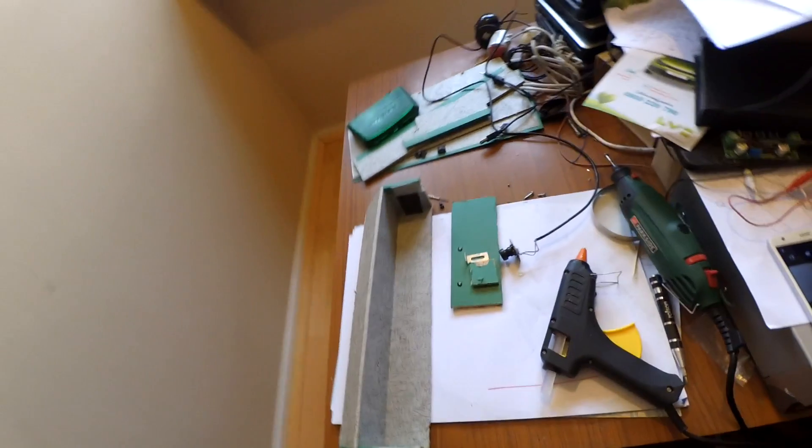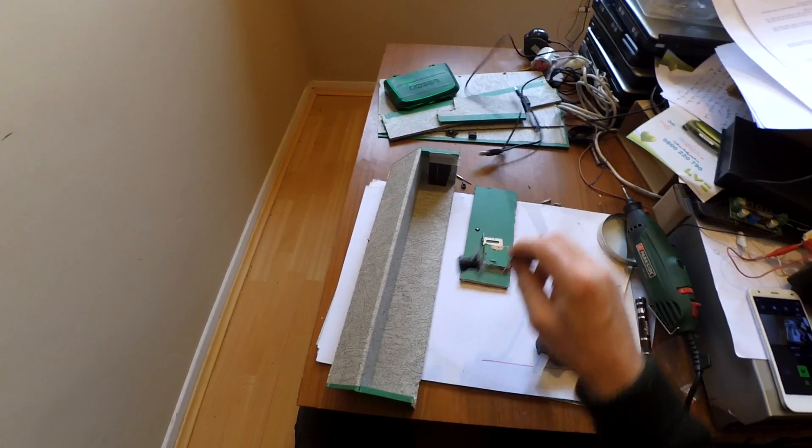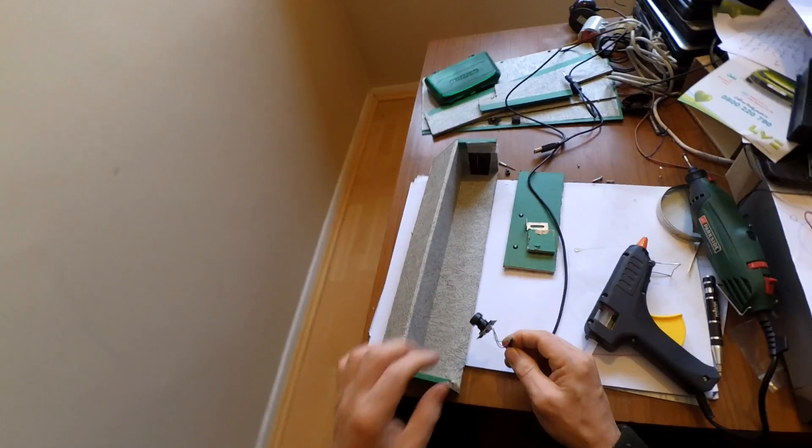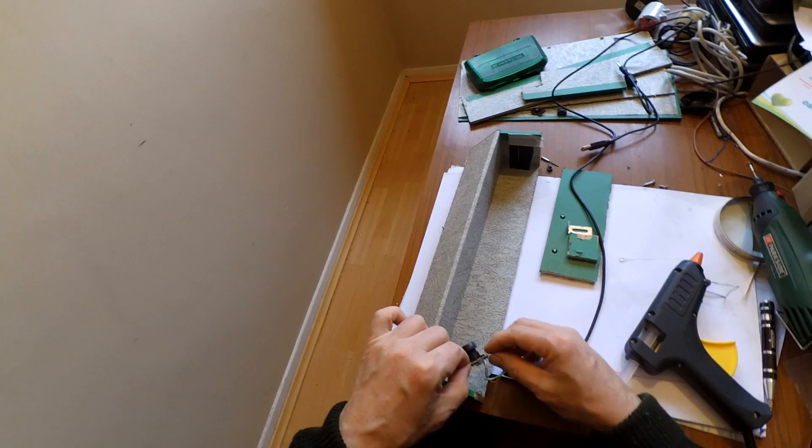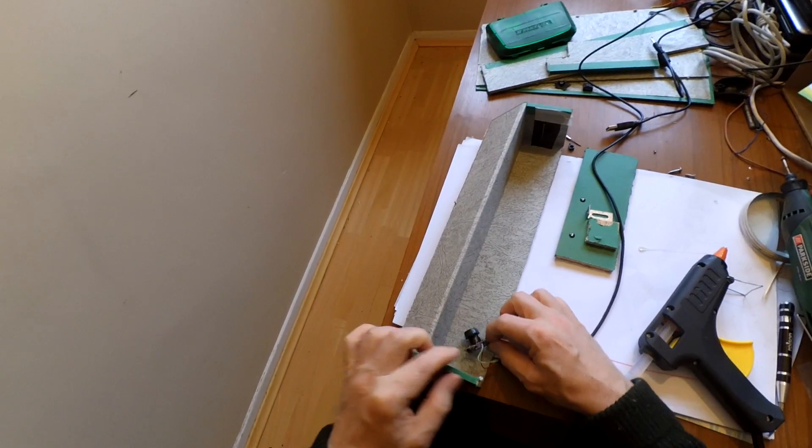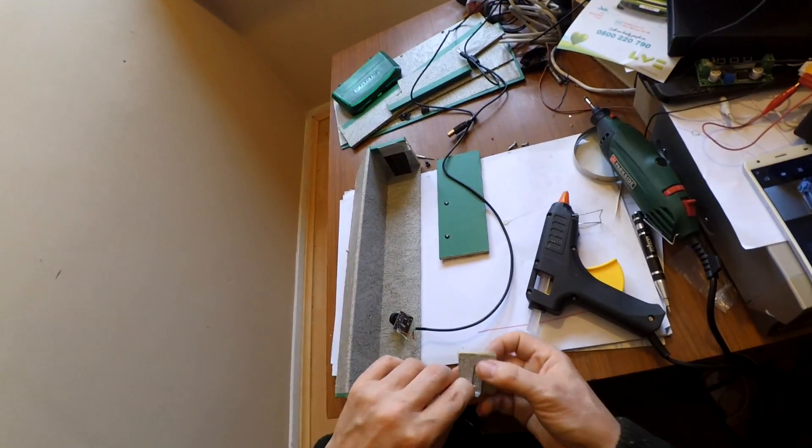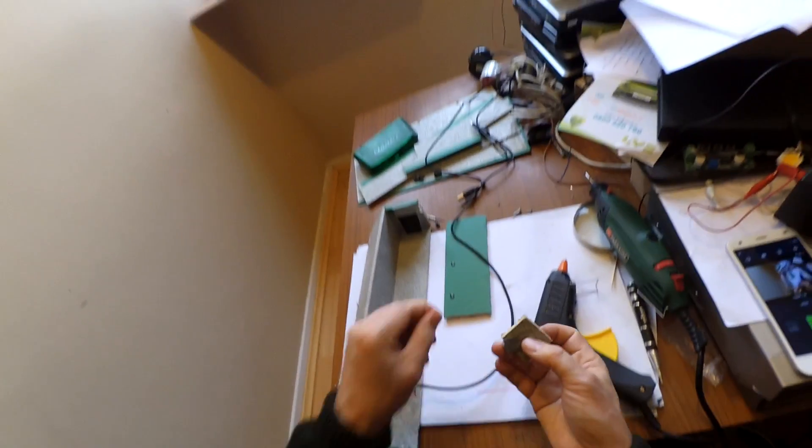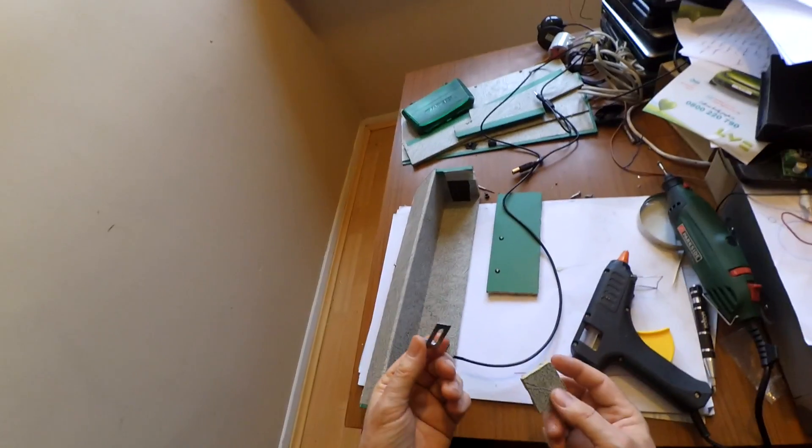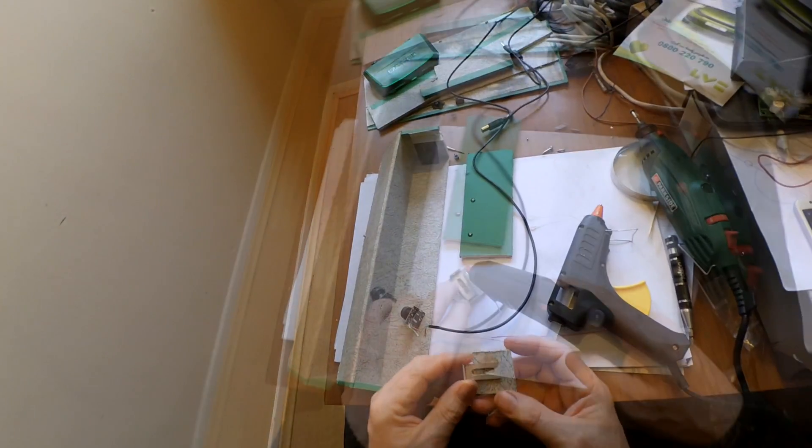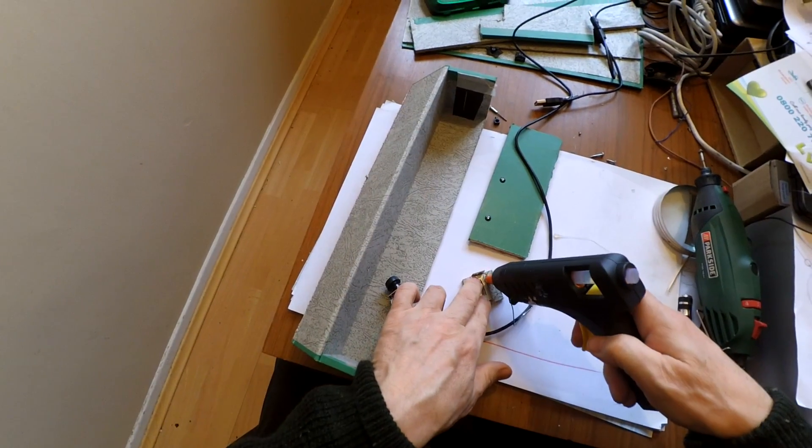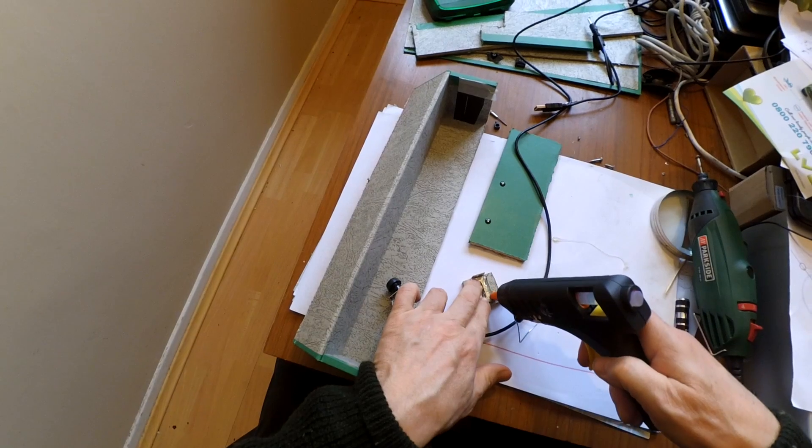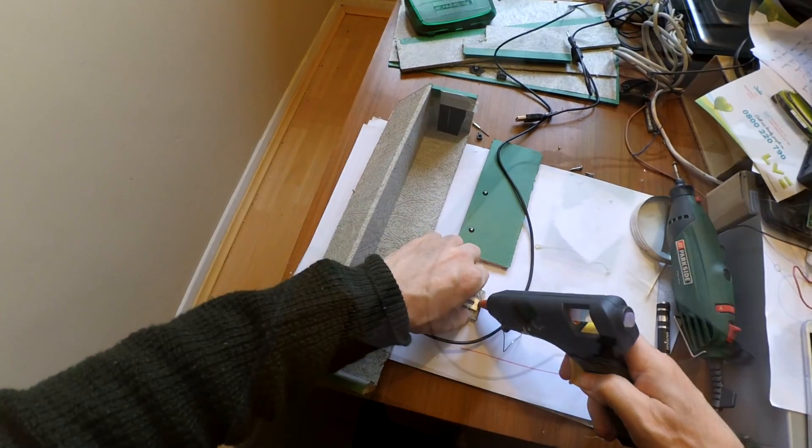I need to find a way to mount the camera board inside the box in a way that's adjustable. I had one of these small brackets which is used for attaching kitchen units to the wall. I decided I would hot glue that to a piece of board and then use a bolt to attach the camera to it.